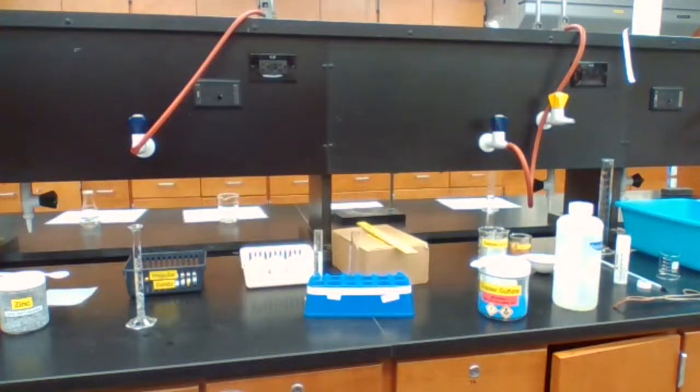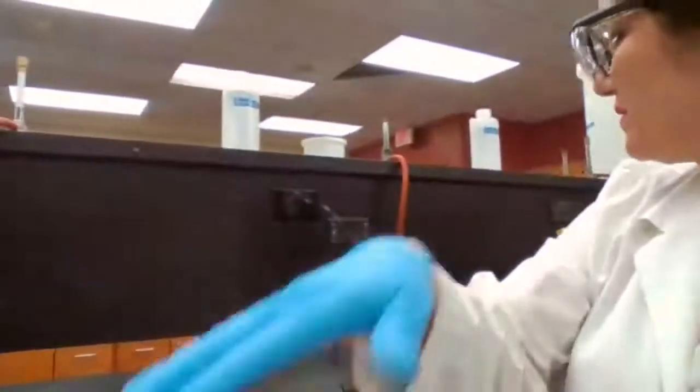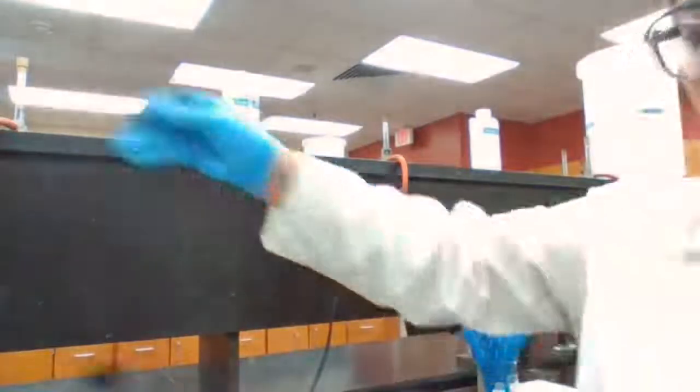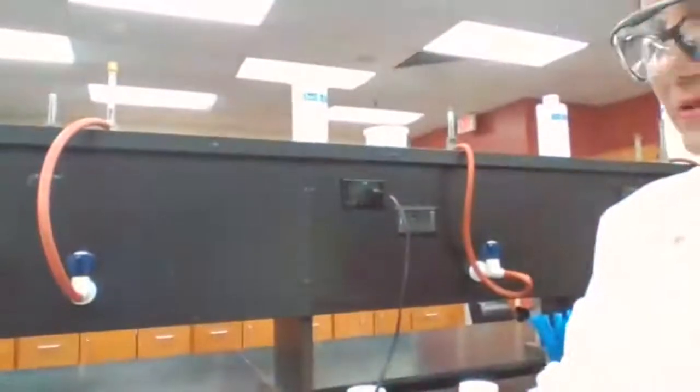Copper, magnesium, and zinc. Next step of the reaction, we want to compare the next part of the procedure. We're comparing reactivity of the three elements. For copper, zinc, and magnesium, we want to know which one is more reactive. One way to find out is to make each react with the same reagent and look for the rate of the reaction, meaning how fast the reaction is going to take place.